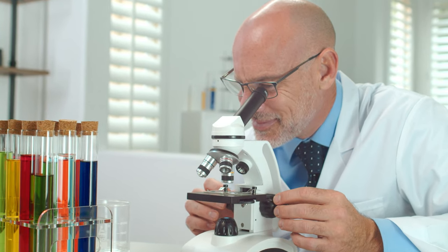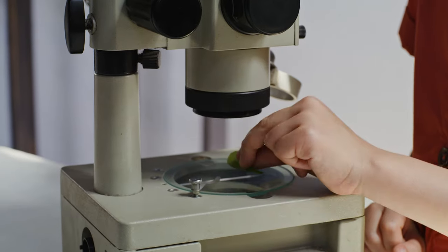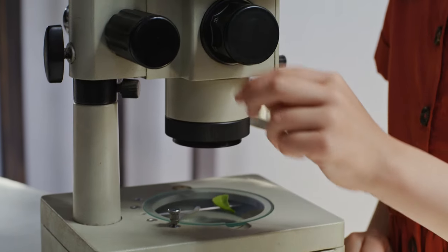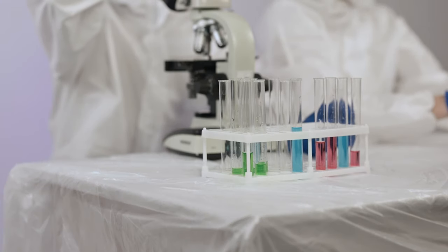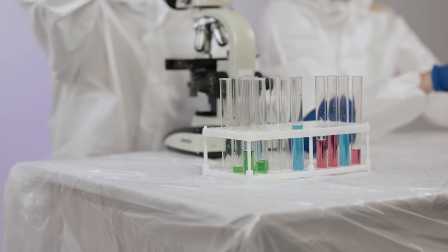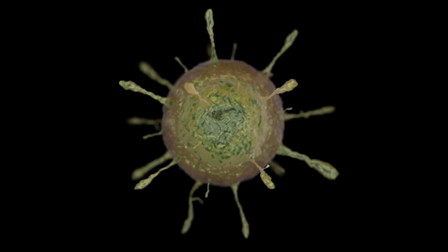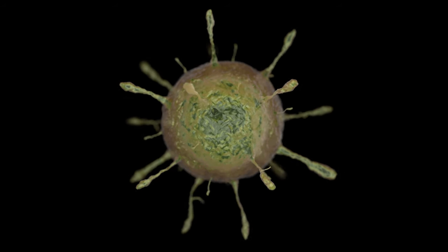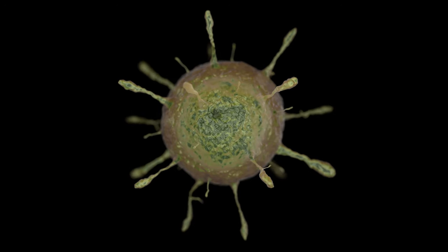What are the problems then, when after all you can endlessly design lenses and create complex systems that will magnify tens of thousands of times, allowing you to see the tiniest details of anything? But it's not so easy, and this is due to the physical limitations of visible light.